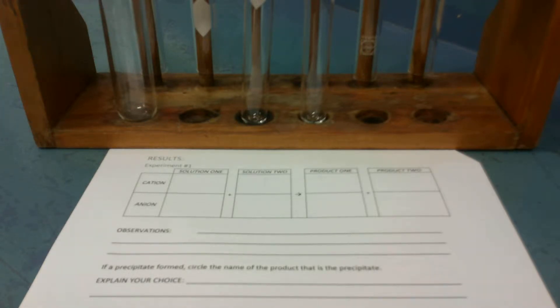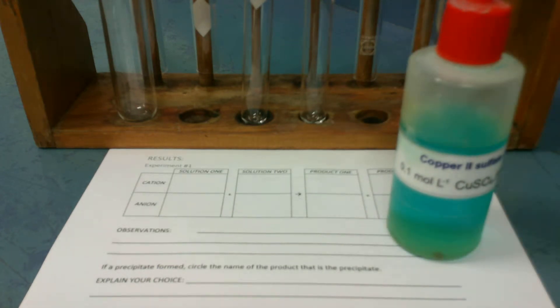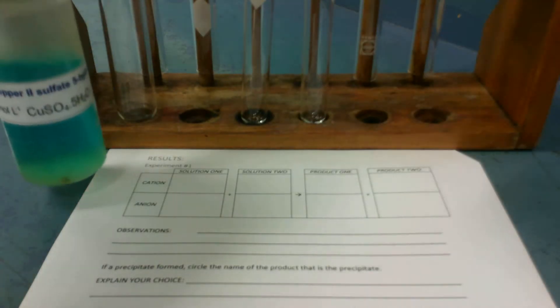So what we've got is two chemicals, and we're going to react them. We've been given this template to write things out. The first chemical we've got is called copper-2-sulfate. So for that, we just write that name, solution 1, so we write that in our box.